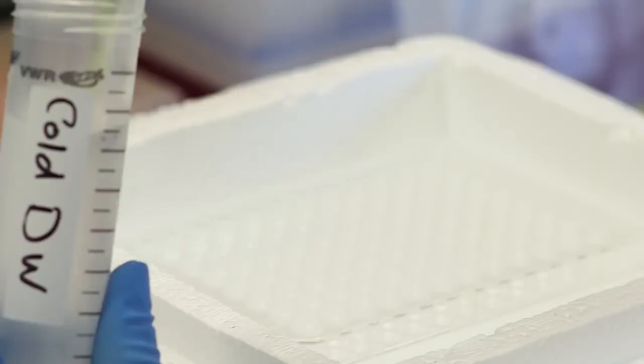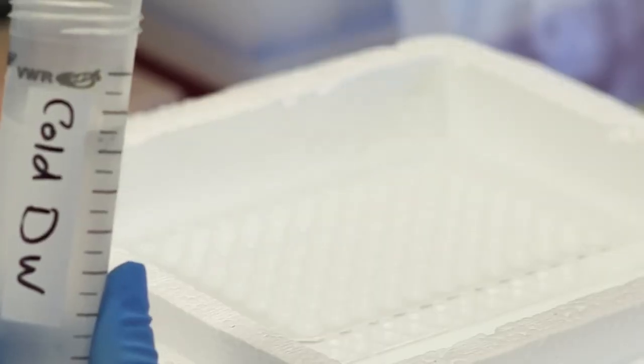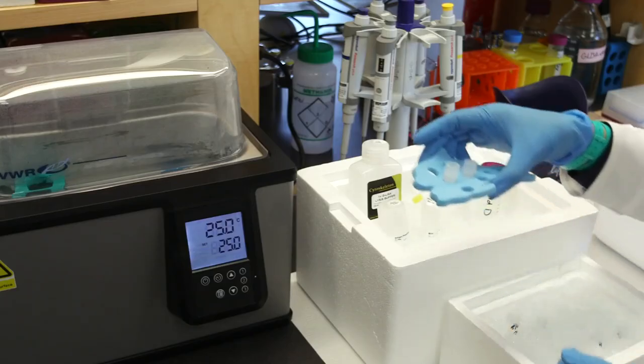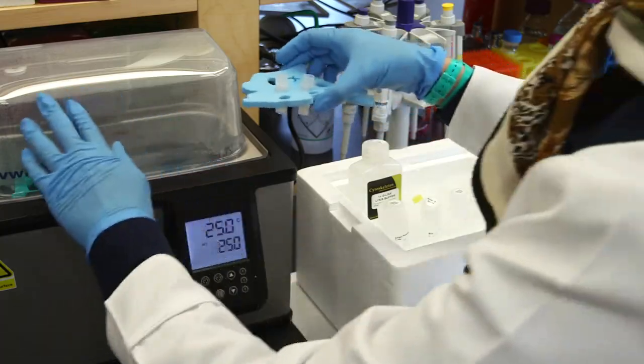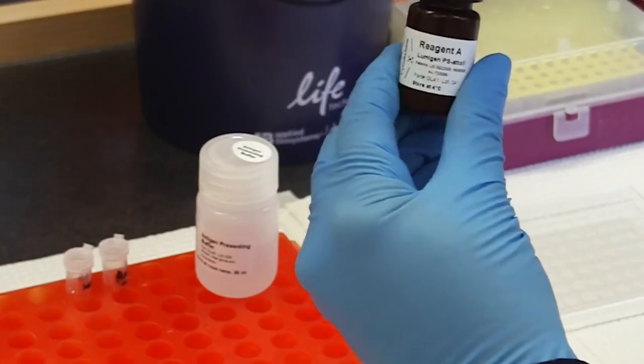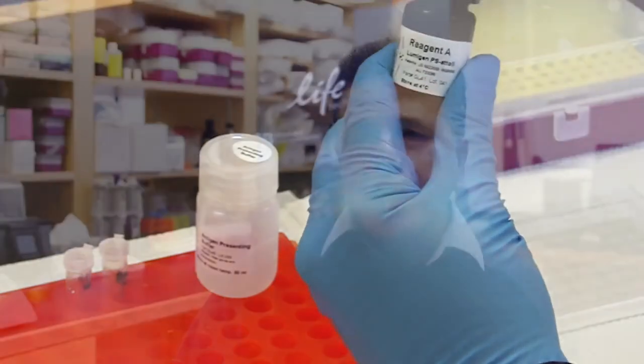For this purpose, we have used localization of Rho A and GTP binding to Rho A to measure the post-translational modification of this protein.